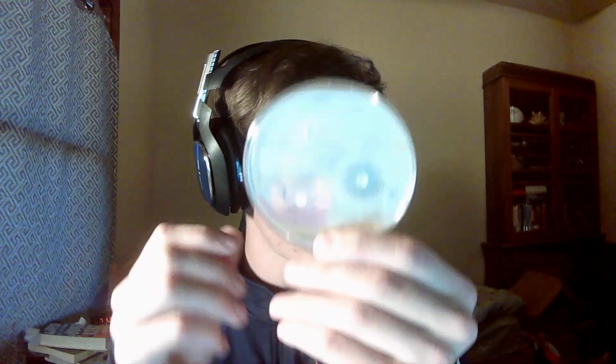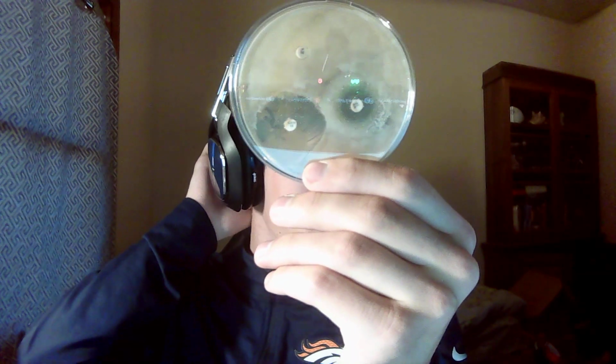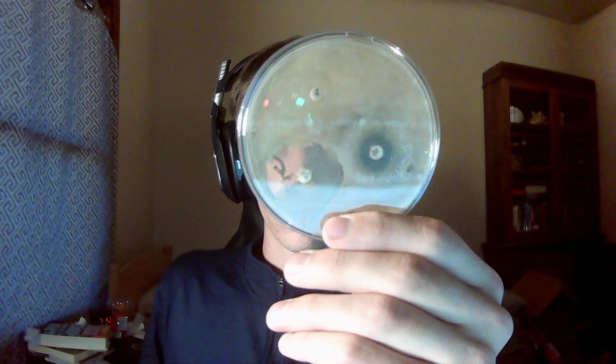But as you can see, penicillin did not do very much. It did not stop any growth, and the bacteria grew all around it. I didn't expect it personally. I expected all 3 of them to do their job, especially since penicillin works well against gram-positive bacteria, and this one is a gram-positive bacteria, I expected it to work well. But that's why we do the experiments. So moving on to novobiocin, the smaller circle, right up towards the top.